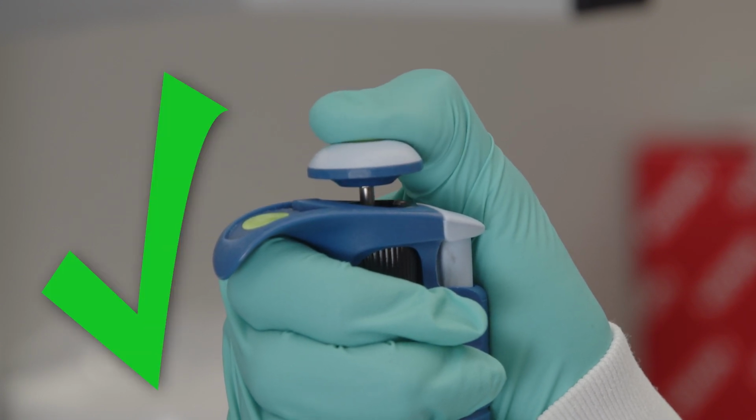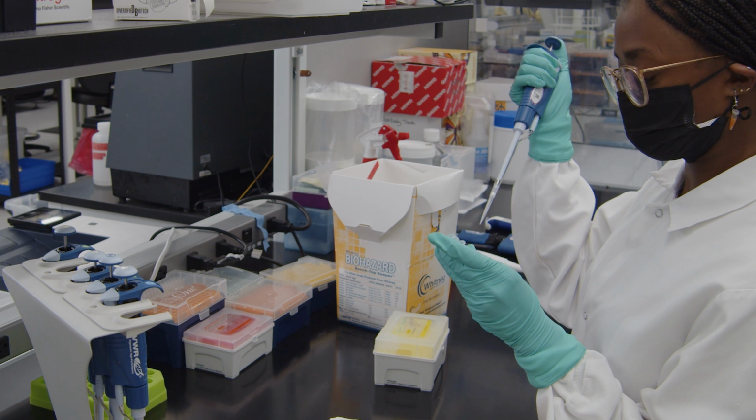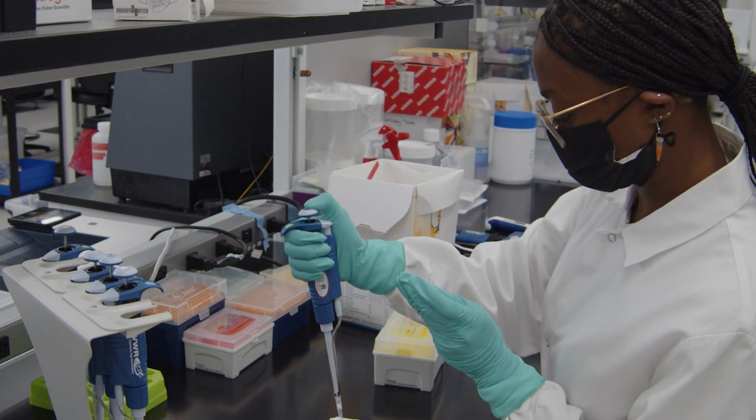Confident in your ability to control your plunger release? Great, now you can start adding some speed into those smooth, controlled movements.